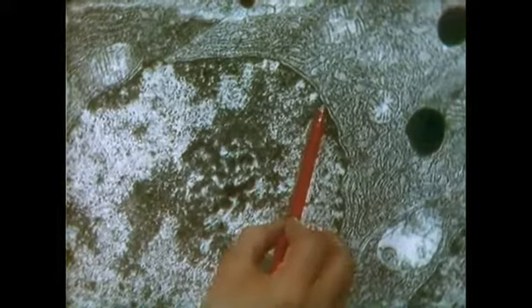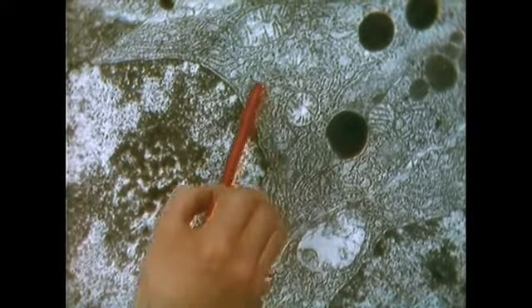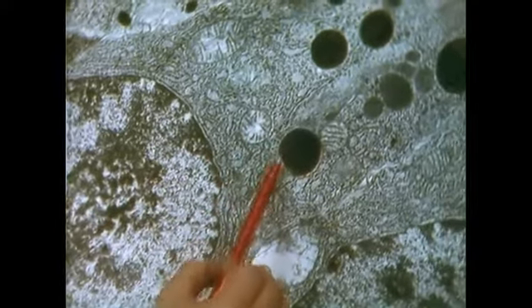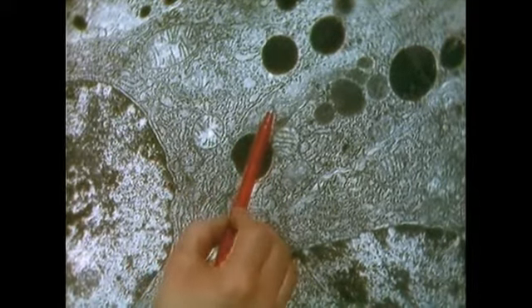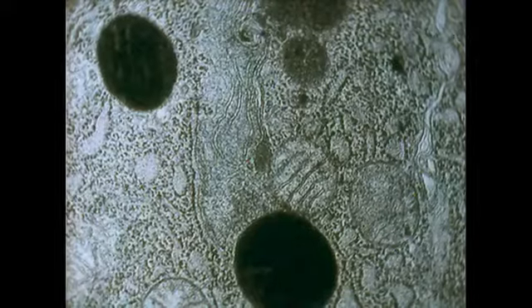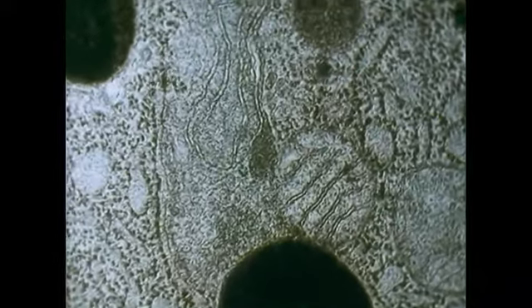And when we move on up the cell, towards the top of the nuclear envelope, there is more rough endoplasmic reticulum, mitochondrion, and here what could be a secretory granule. This would contain enzymes. And here is the Golgi apparatus. If we look at this in more detail, we can see sacs of what are called Golgi cisternae. And at one end, we can see a number of what are probably condensing granules which are being packaged by the Golgi body.